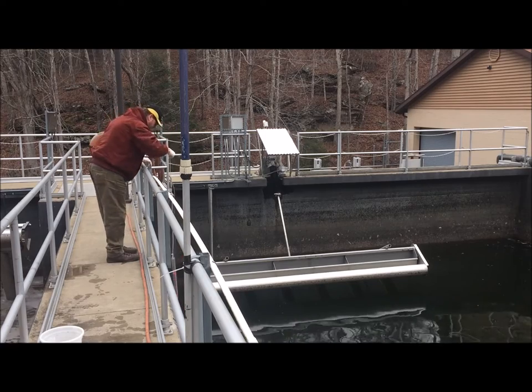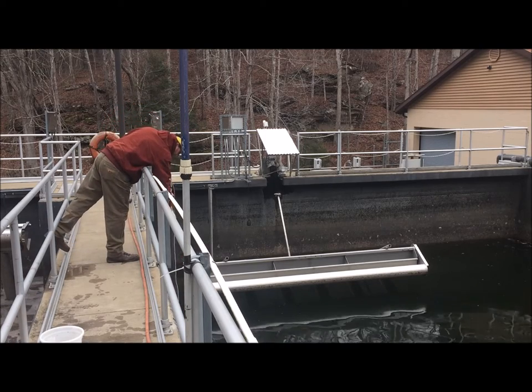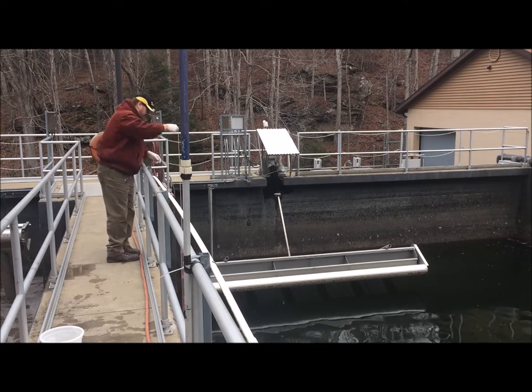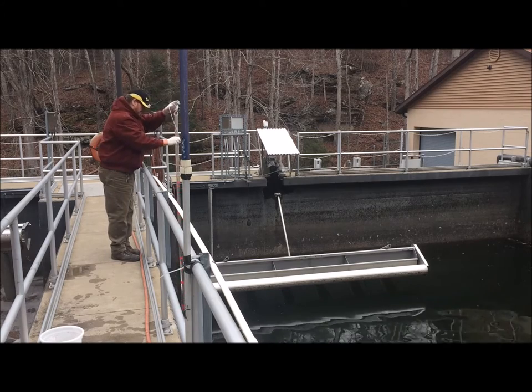Since we have two aeration basins at different stages, now is a good time to check the sludge depth in aeration basin number one while it's in the settling stage. So that's what's being done here.